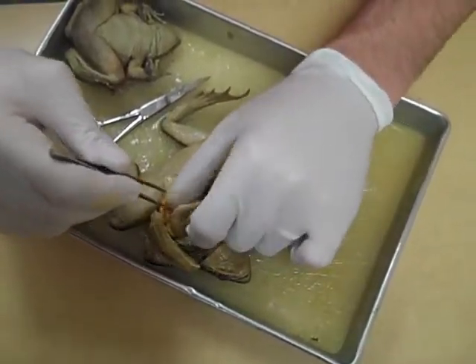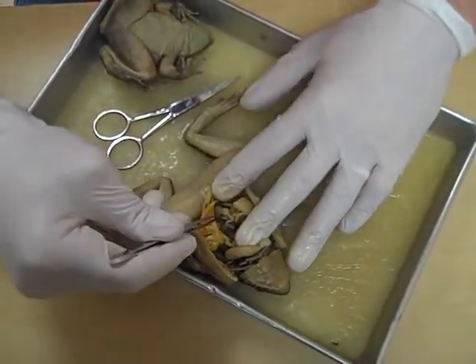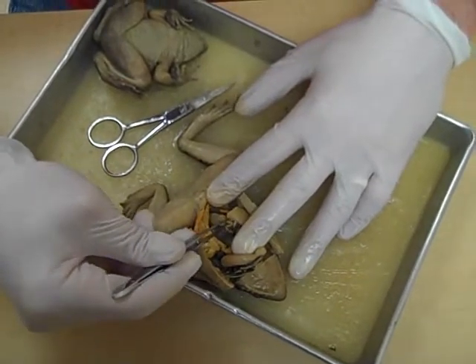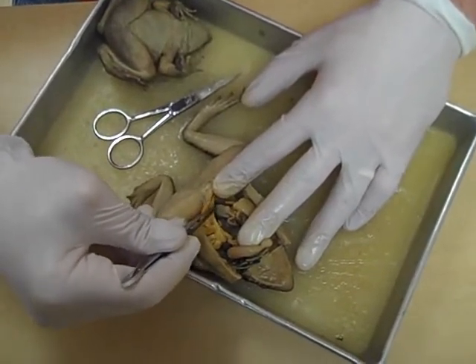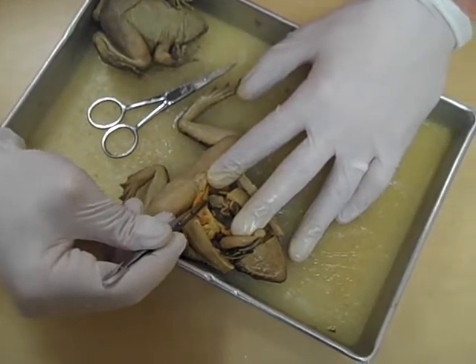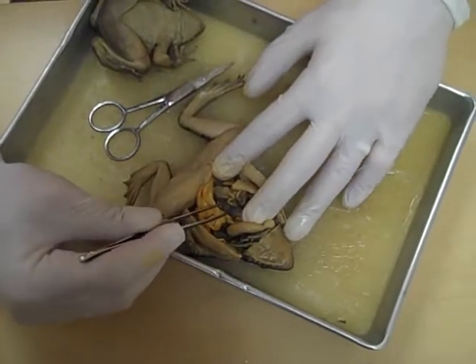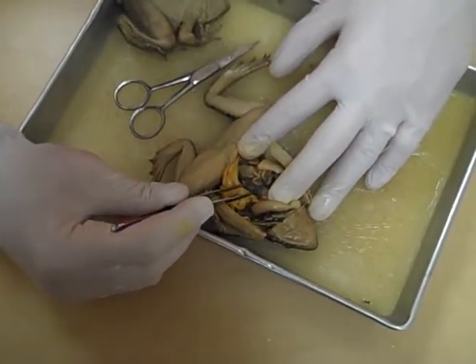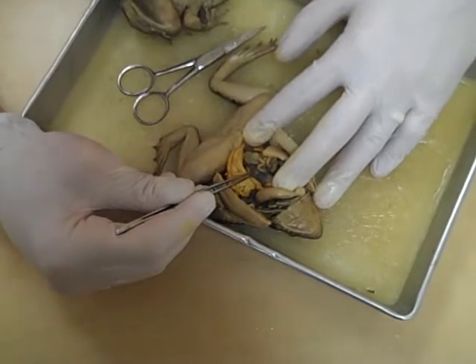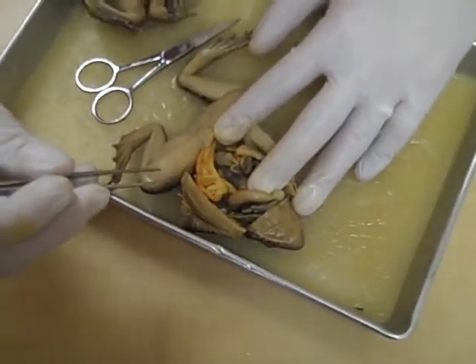Eventually we hit the large intestine, which in a frog is quite short. Here's the end of the small intestine and here's the large intestine — it's quite small. A structure that I don't talk about a lot, but the kids always ask me about, is this one right here. It's only on the frog's left side, and this dark ball structure here is called the spleen.